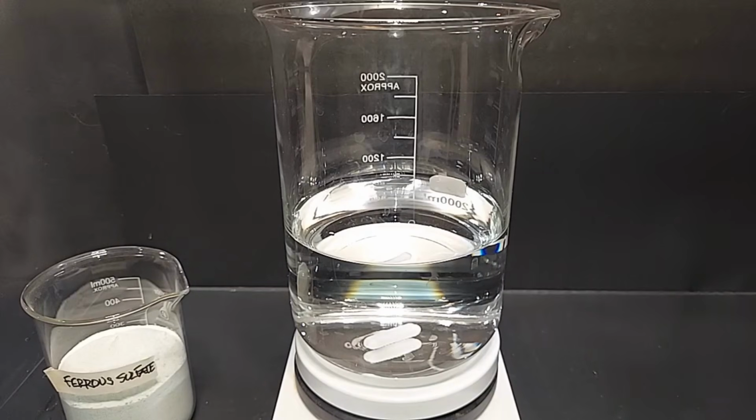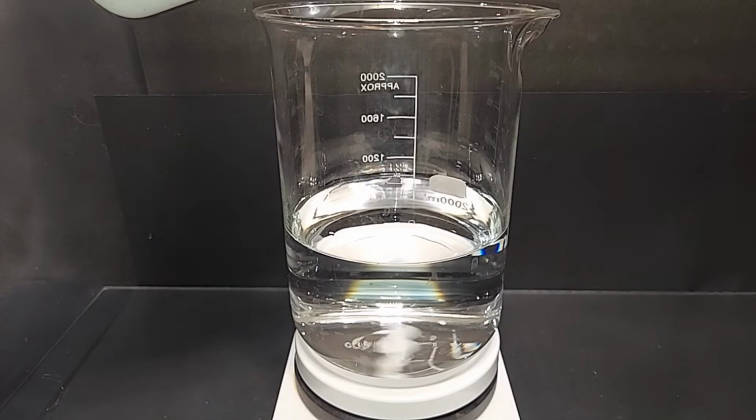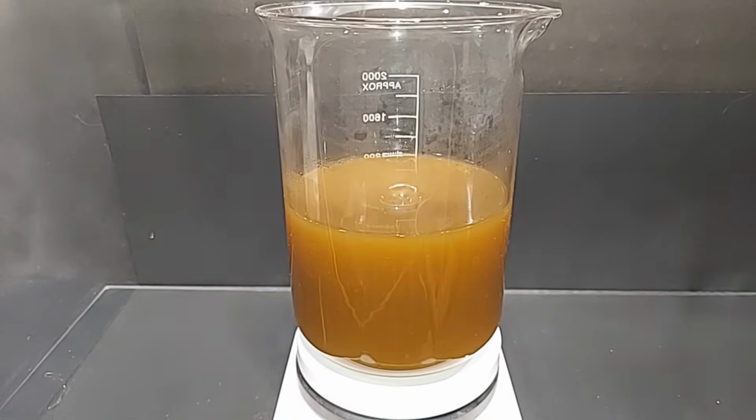Now that the other two ingredients are dissolved, we can mix our ferrous sulfate with the 1 liter here. So I'm going to turn on the magnetic stir, and we'll start doing that. All of the ferrous sulfate has dissolved. I did get it up to around 50 degrees Celsius in order to do that, but it's done, and now we can start adding other things to it.